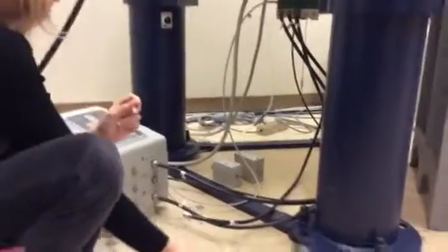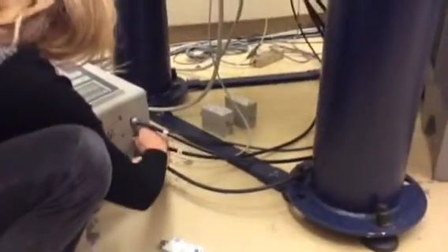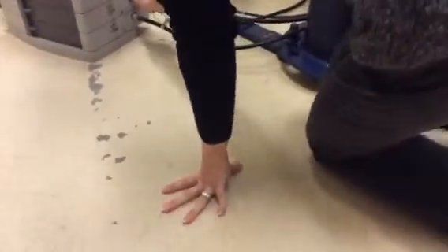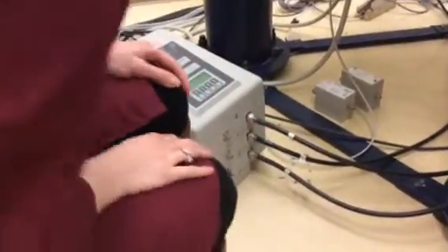You take it off, and then you reconnect the RF cable to the preamp. And actually, you know what, Olga? Why don't I let you do this part? So it just slides on, and then you just have to turn clockwise to get it to catch, until it's finger tight. That way you get kind of a feel for it. And then, we'll of course set this aside and put it back on when you're done.